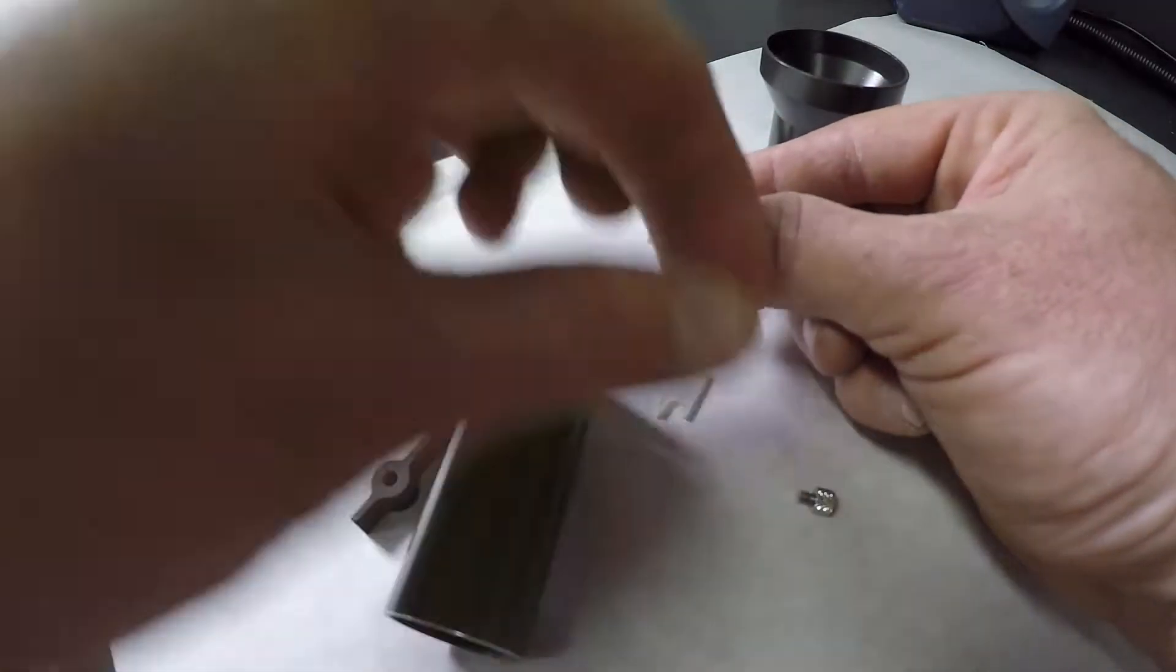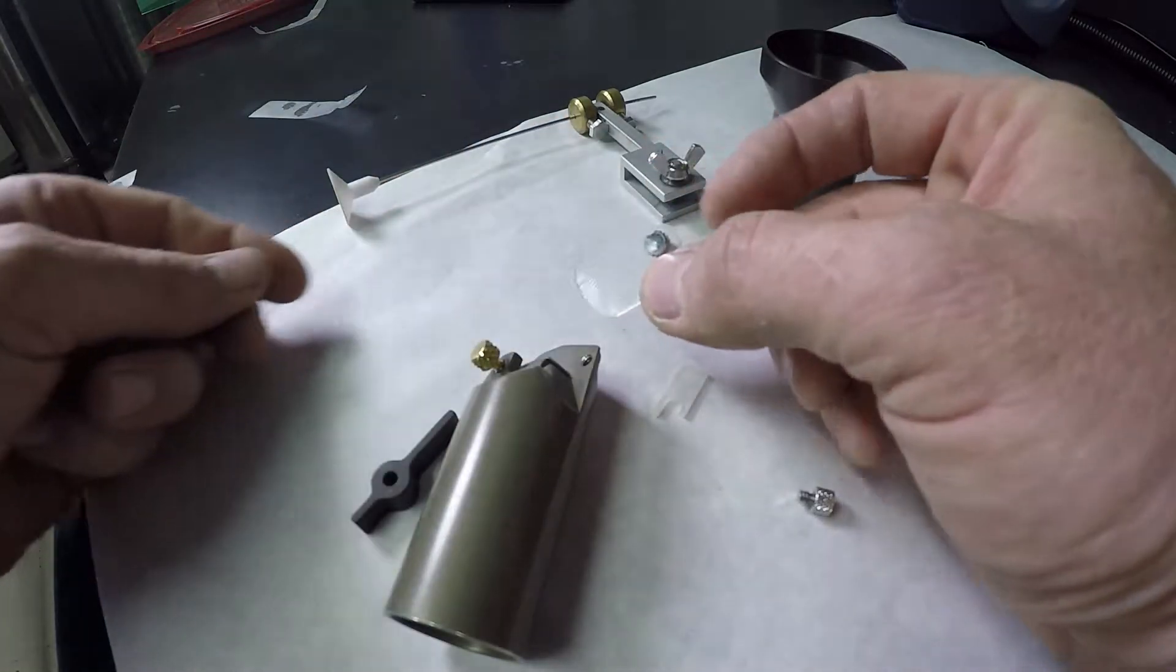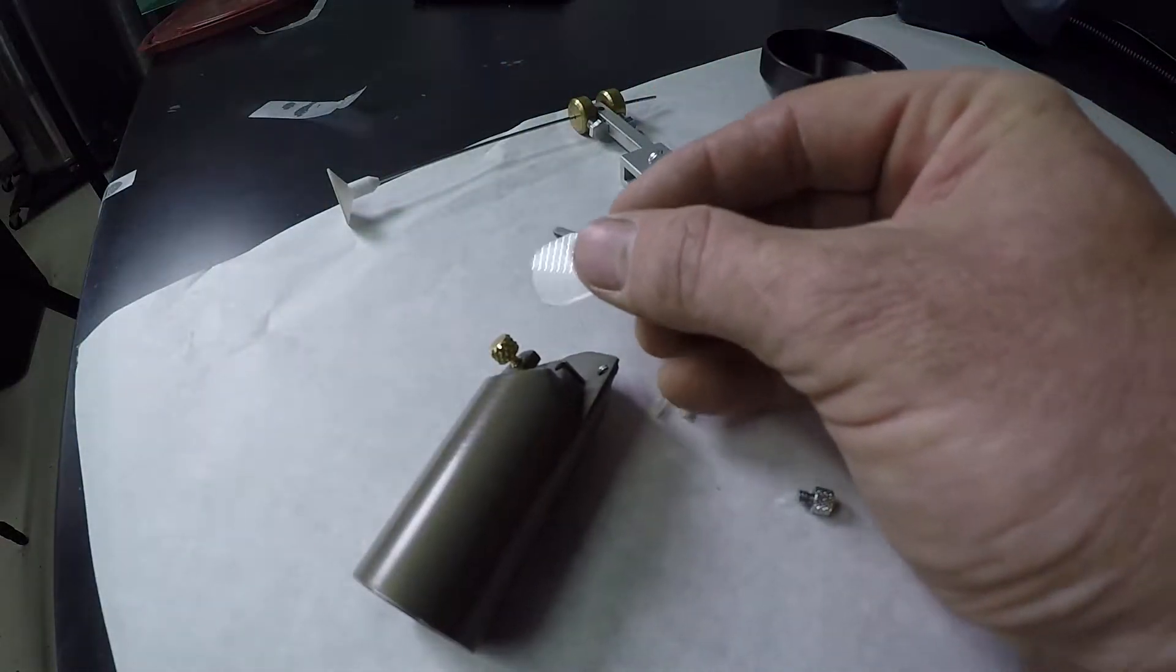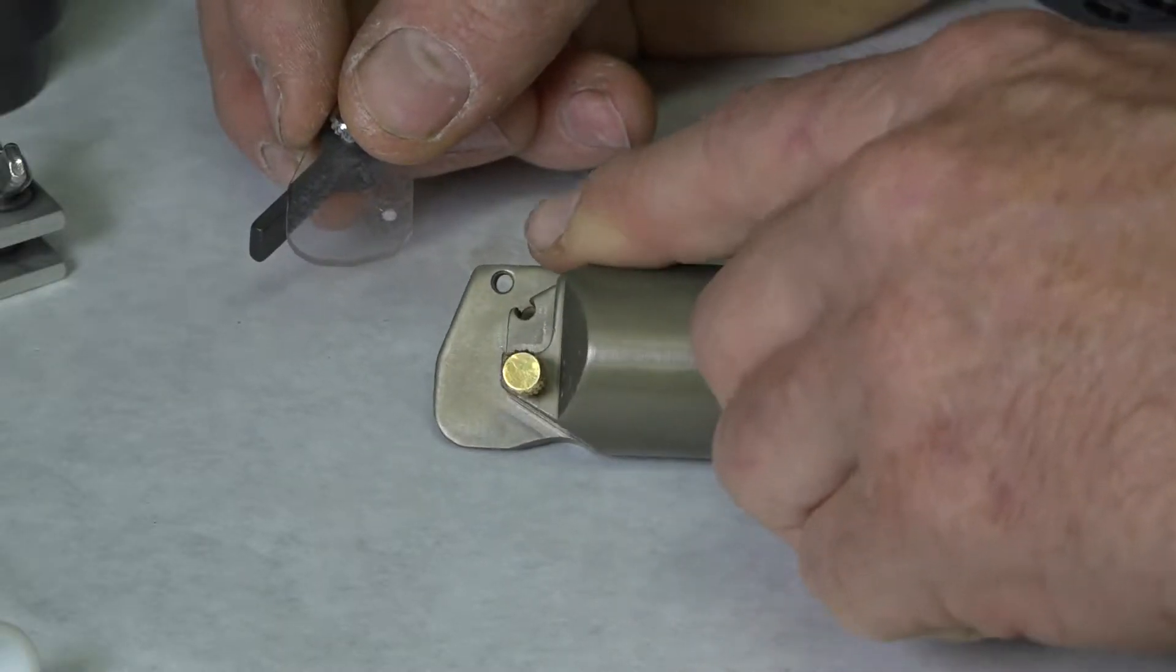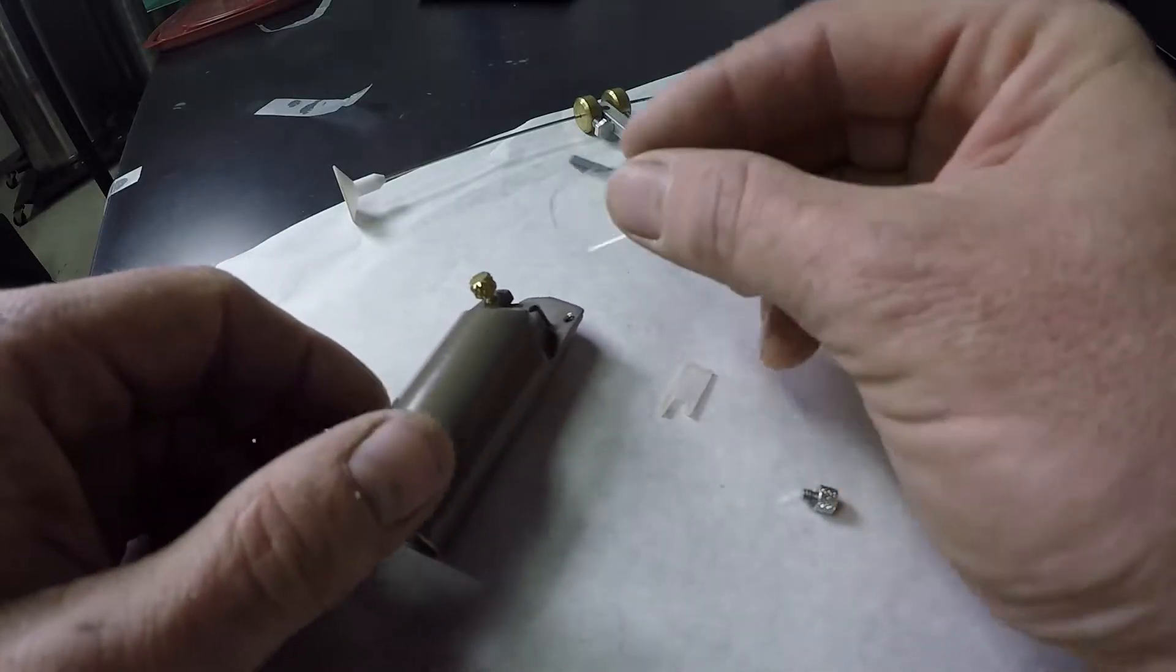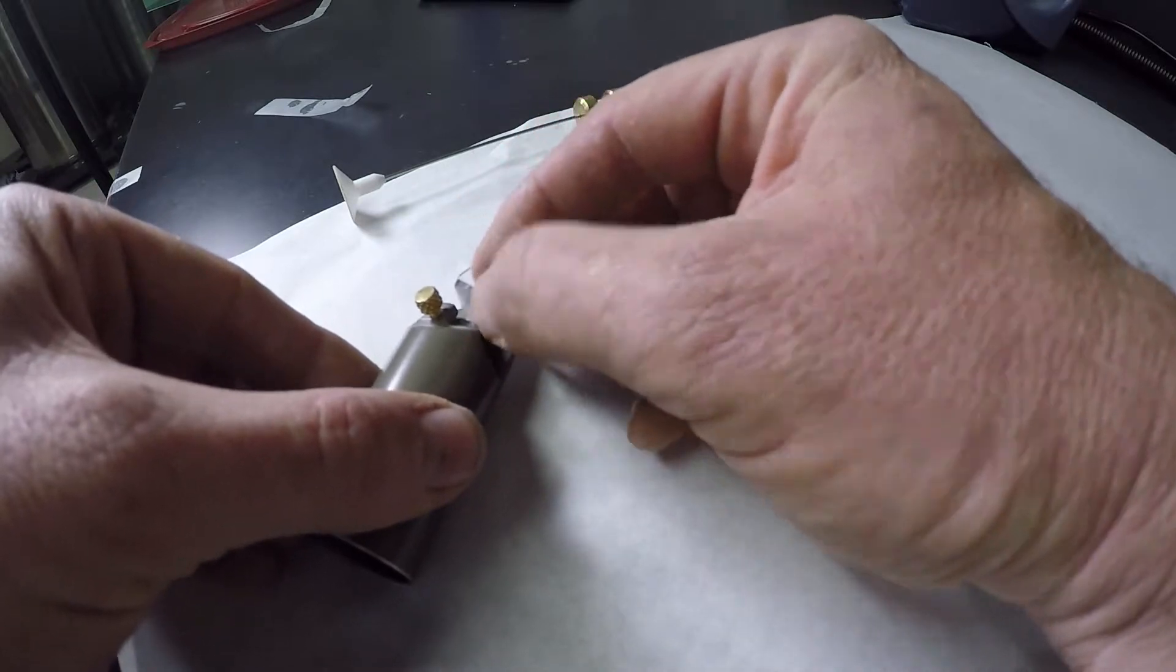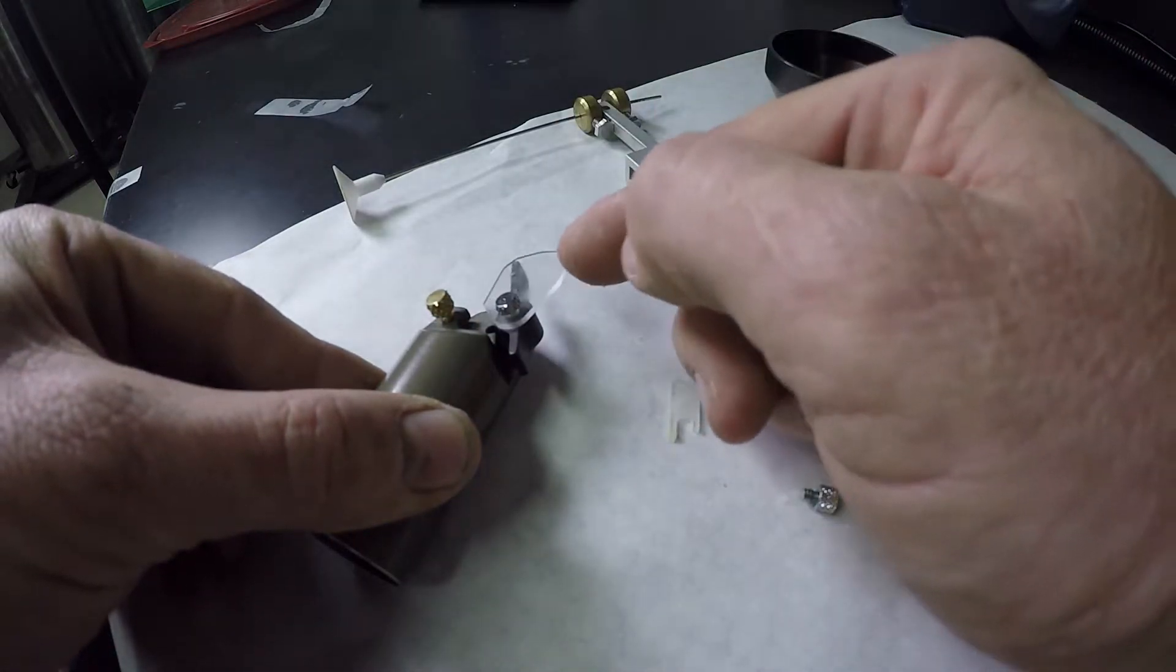Put your hinge screw through there through the plastic. Once that's through the plastic, then you take your mini ramp and you can actually put that on the same system and you're going to thread it into the back of that hole right there. So you have your three things here on the ramp put together. You want them out of the way, so aiming down, and then you start the threading.